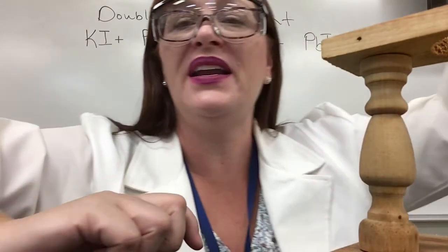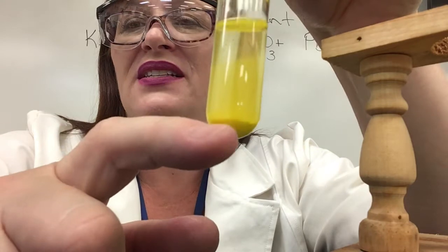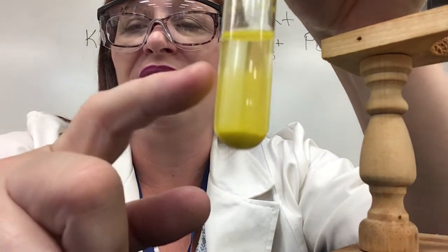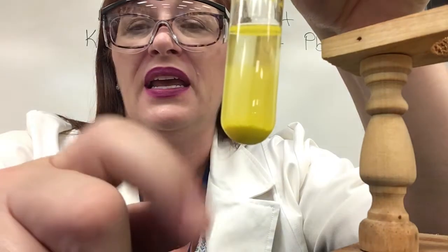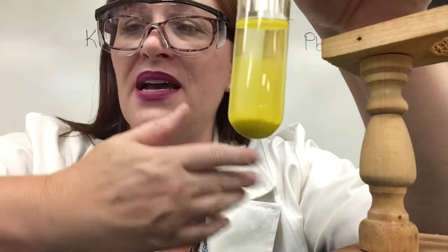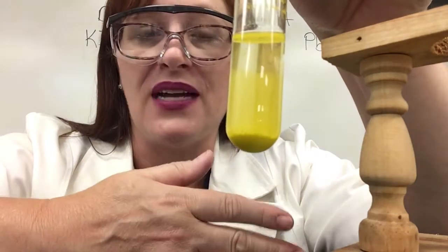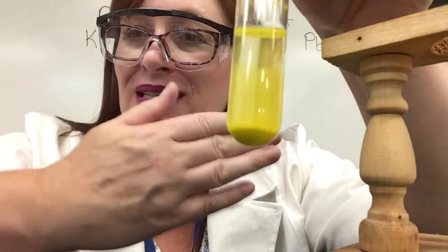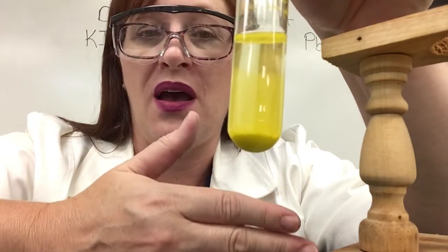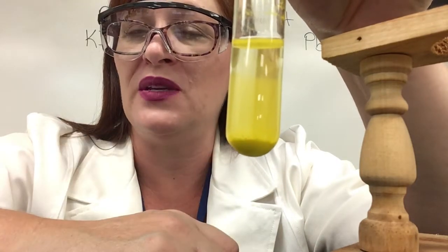If I wait a while I'm gonna find out that this is not actually all liquid. There is a solid product in here and that solid product is gonna sink to the bottom — that is called the precipitate. A lot of times in double displacement reactions one of the products is actually insoluble in water. Insoluble means it does not dissolve, so it's gonna be forced to become a solid, and that solid will be more dense so it sinks to the bottom and you can see it.